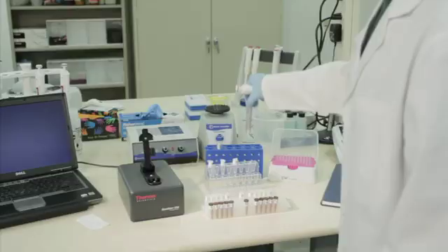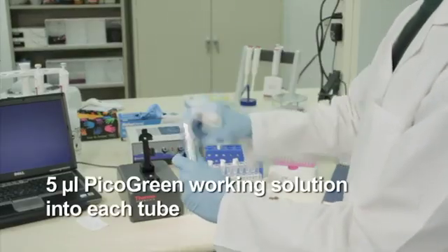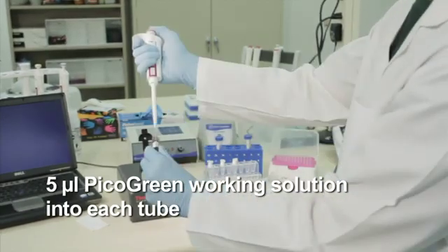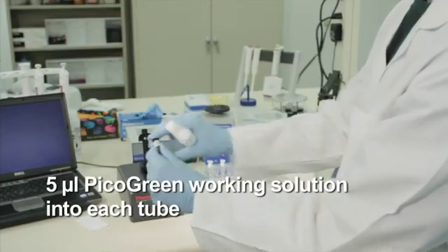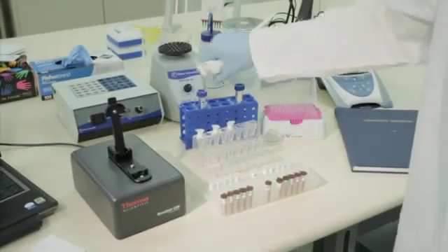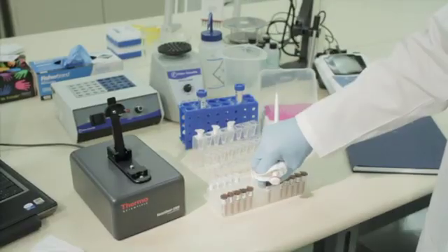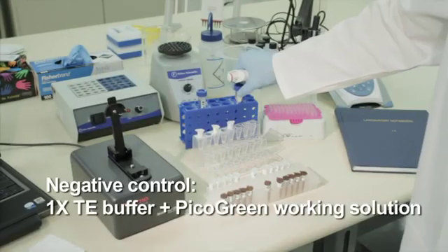After preparing the pico-green working solution according to the manufacturer's protocol, transfer an equal volume of the solution to each tube containing either double-stranded DNA standard or double-stranded DNA sample, in this case 5 microliters. Combine equal volumes of 1xTE buffer and pico-green working solution to prepare the negative control, which serves as a reference solution.